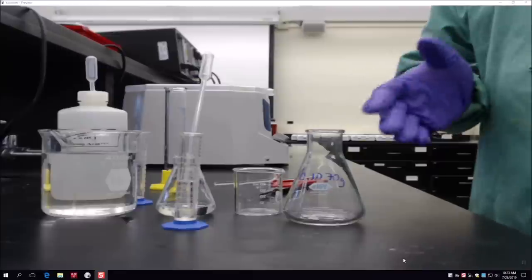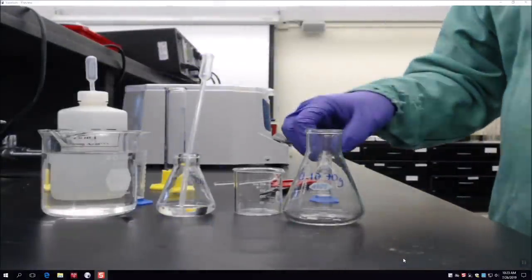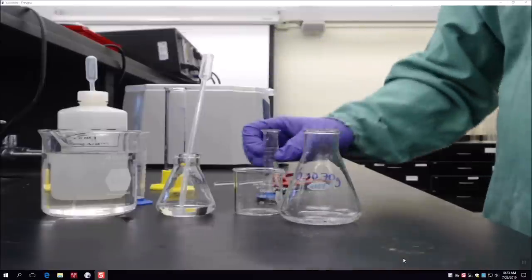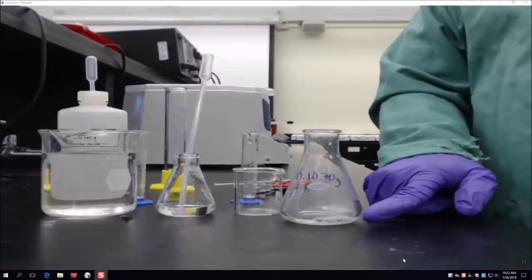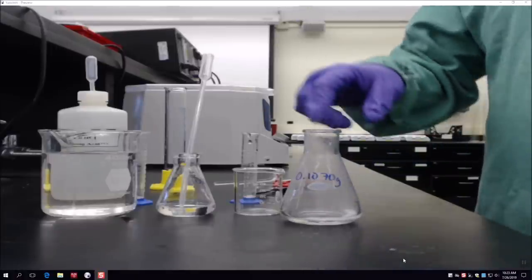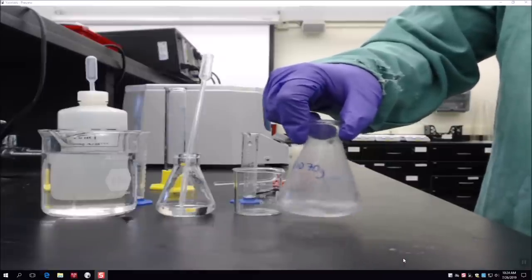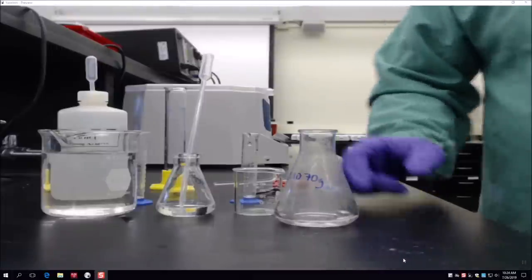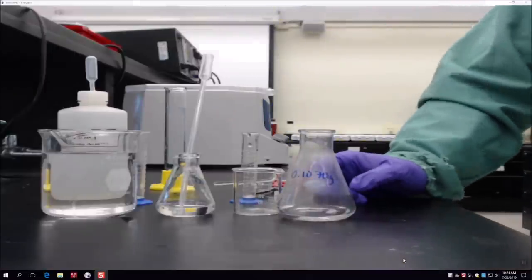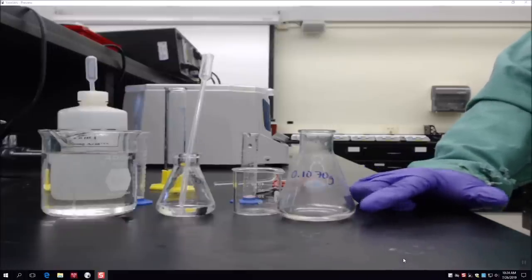In this video we're only showing one reaction, but in the lab you'll have three different reactions, which is why it's important to label all your Erlenmeyer flasks. I'm going to take my 6 milliliters of 3 molar HCl and pour it into the flask. You can see there are a lot of bubbles forming — that's because we're forming hydrogen gas when magnesium reacts with hydrochloric acid. We'll give it a little stir to ensure the magnesium is mixing thoroughly with the HCl.